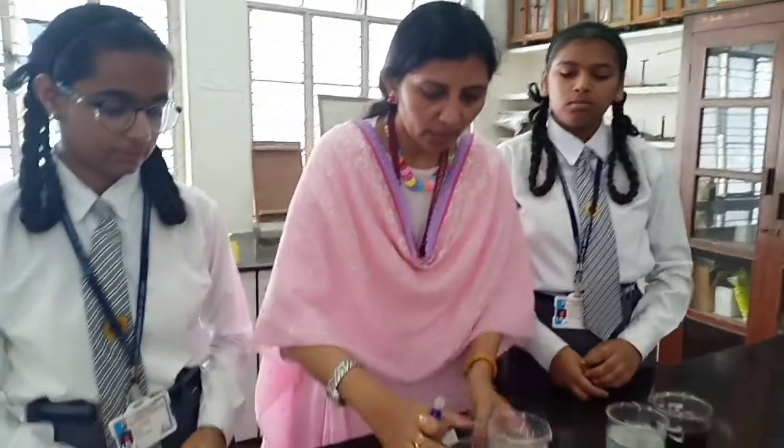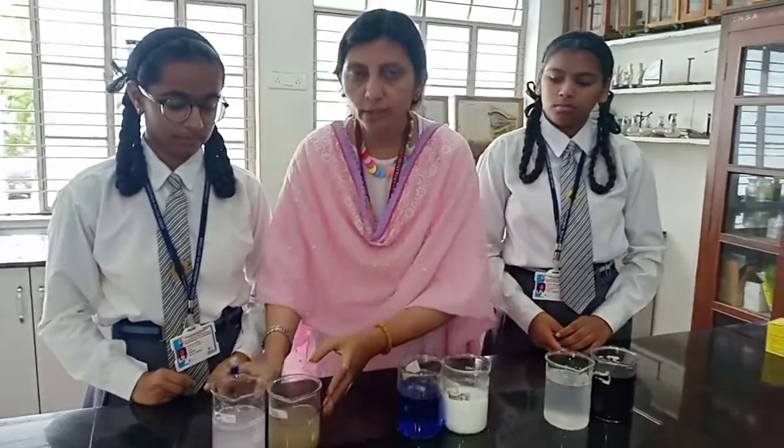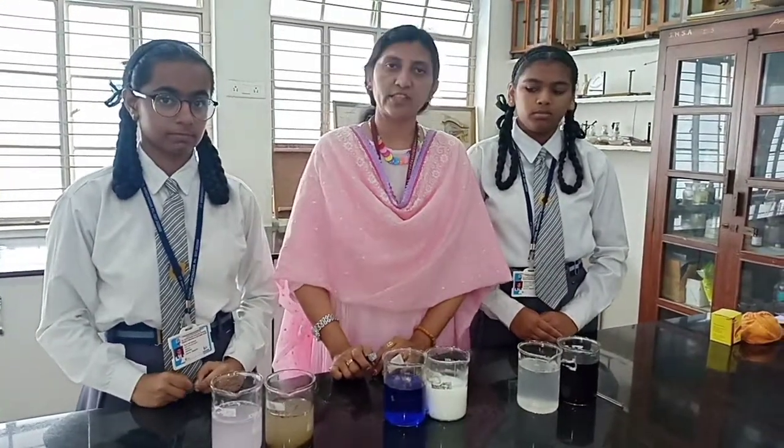In this way we are able to identify the homogeneous and heterogeneous mixture with the help of the Tyndall effect. Thank you.